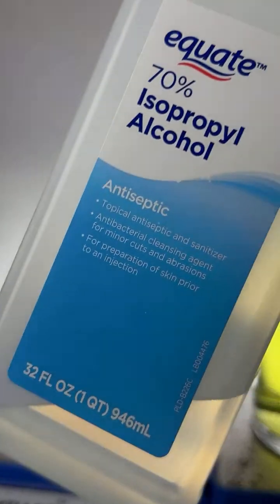Hovig, any kind of dye works fine. Is there a special dye? Is it regular home salt? So Hovig, you can do this with regular home salt. If you're going to use regular home salt, I would suggest you use 91% isopropyl alcohol, not 70% as I've used here. And the dyes, oh man, with the regular home salt, if you can get blue and red together, I think that works. But you have to experiment. I can't really remember.